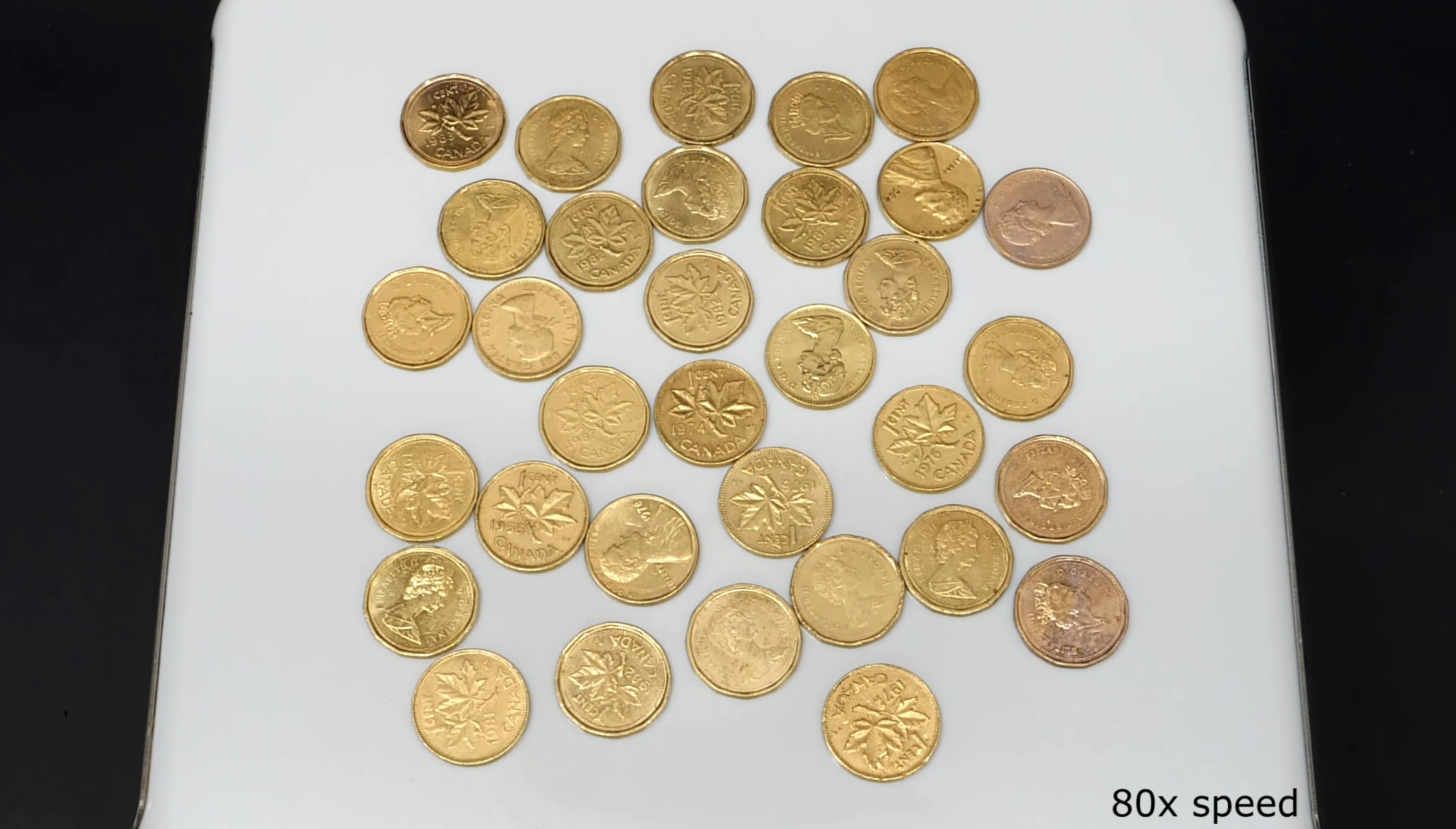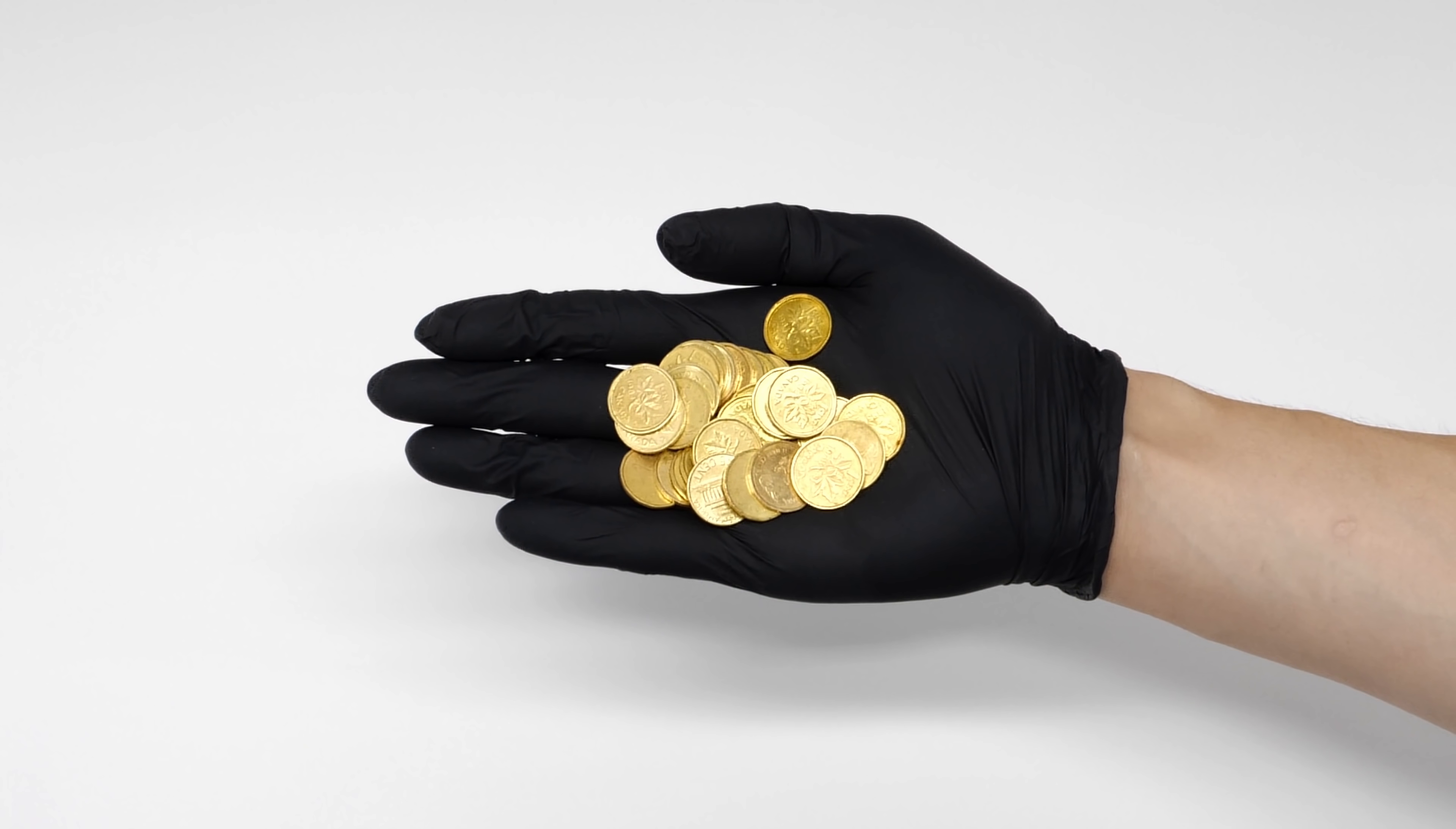Just for fun, I decided to make a whole bunch more, but I have no idea what to do with them.